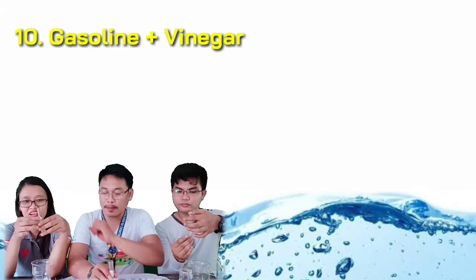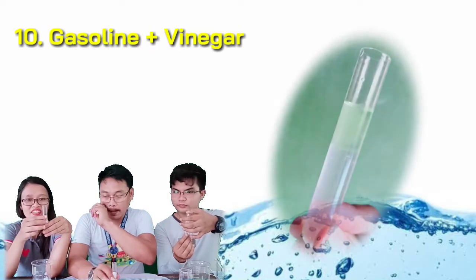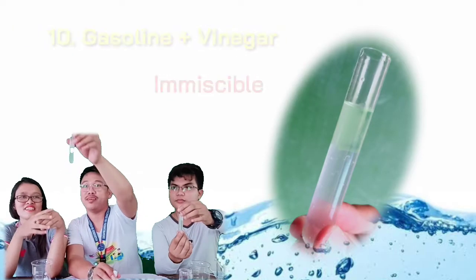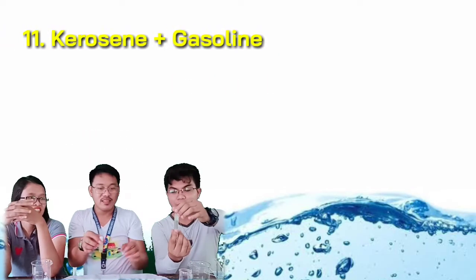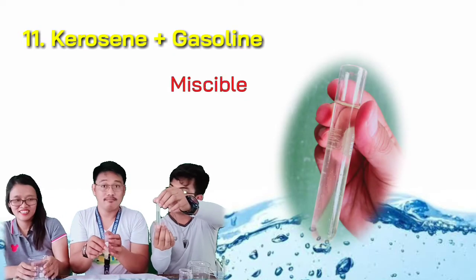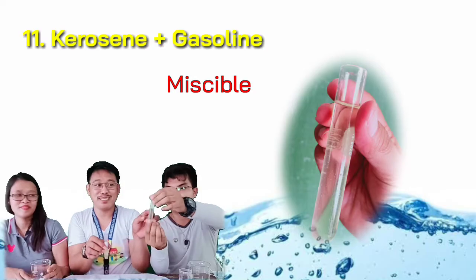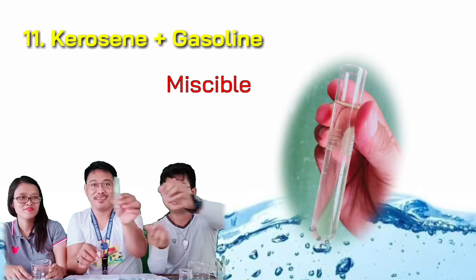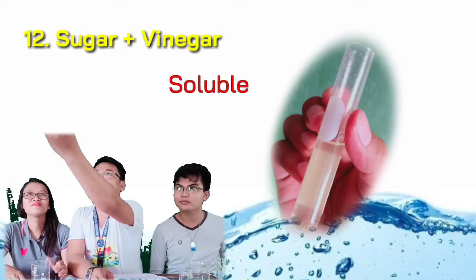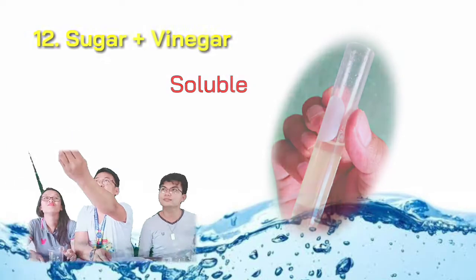For setup number ten, gasoline and vinegar: it is immiscible. For setup number eleven, kerosene plus gasoline: as you can see, this mixture is miscible. And for setup number twelve, sugar and vinegar: it is soluble.